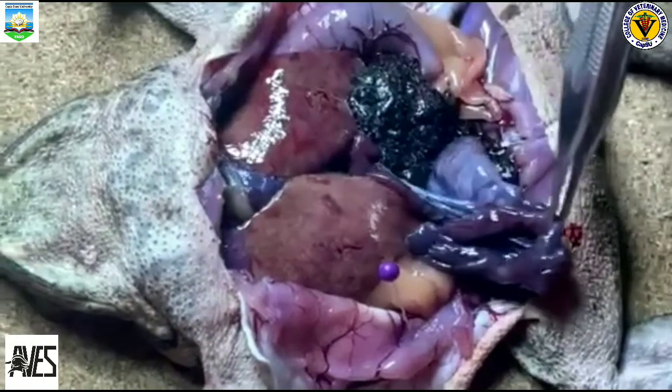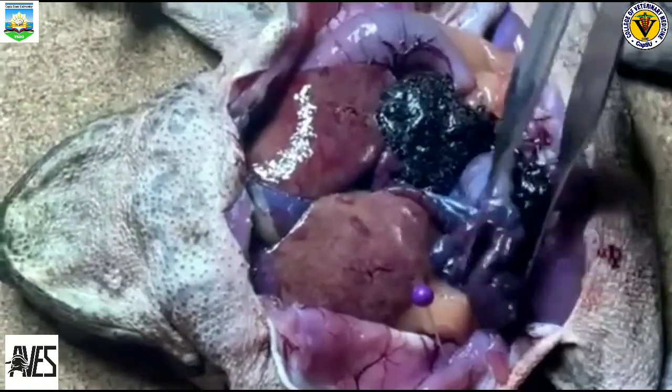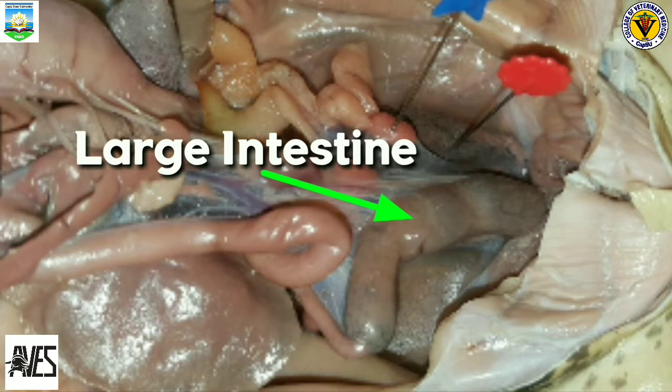As we follow the small intestine down, it widens into the large intestine. So this is the large intestine of the frog. It leads to the cloaca, which is the last stop before solid waste, sperm, eggs and urine exit the frog's body. The large intestine is the posterior organ of the digestive system which stores undigested food.